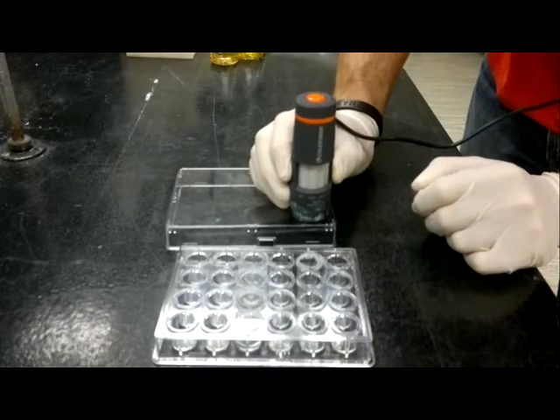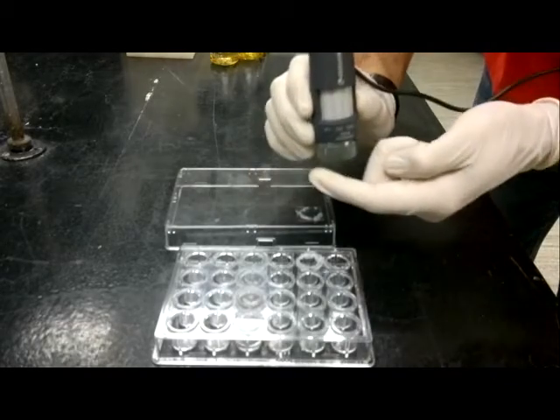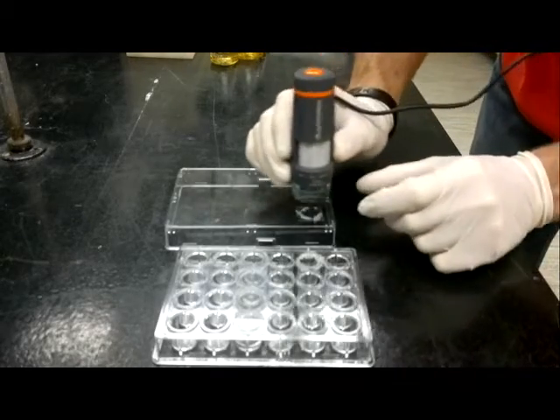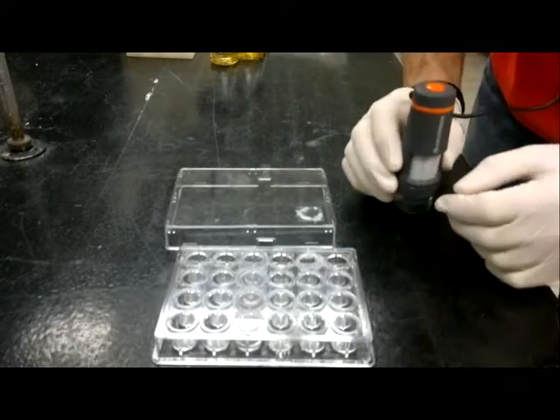Now, be careful at this point because you've got the petroleum jelly. It may actually contact the microscope. When you lift it up, your cover slip may come with it. So you want to be a little careful not to spread that around and not to flip your cover slip off and lose your crystals.